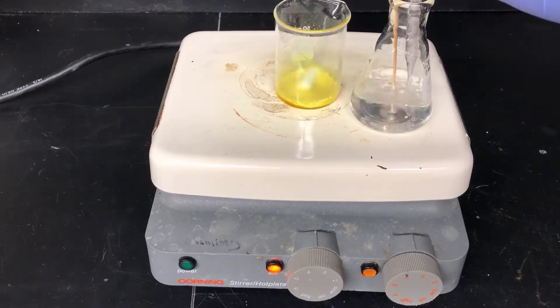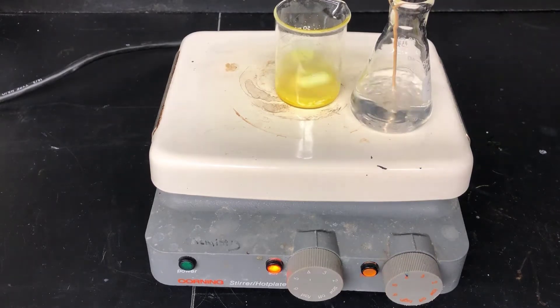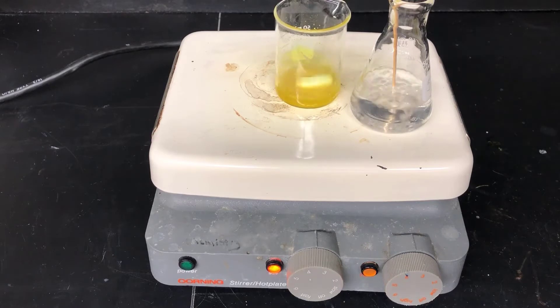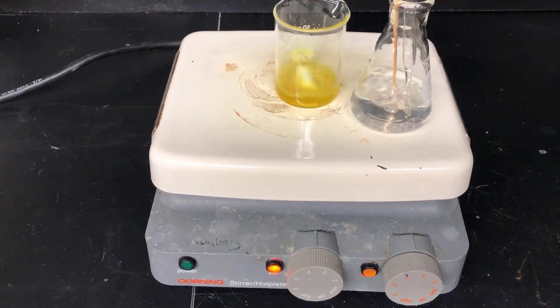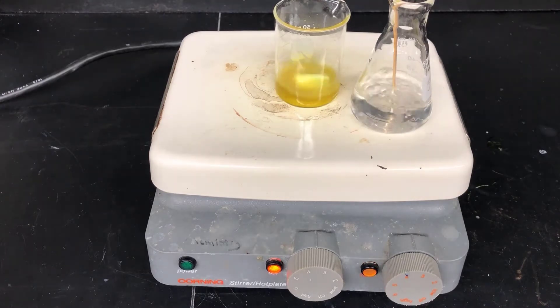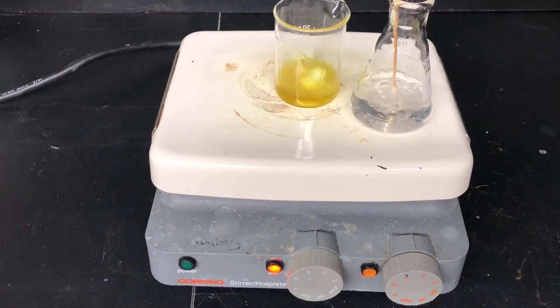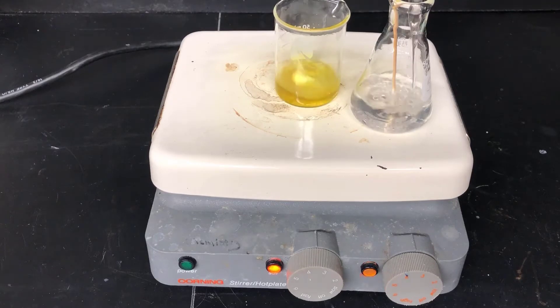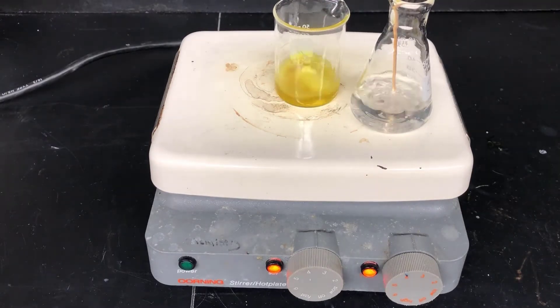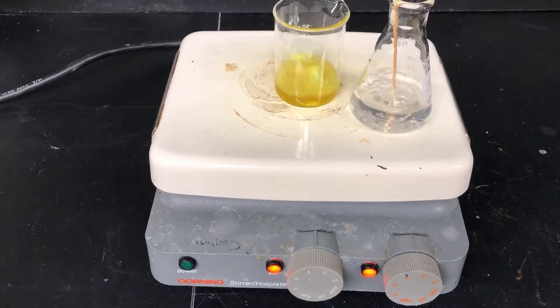I'll need to add more to get it to dissolve, so I'm adding the boiling isopropyl alcohol one pipetful at a time, watching to see if the product dissolves. If it doesn't dissolve, I'll add another squirt and keep doing this until I add enough boiling isopropyl alcohol to just make the solid dissolve. While adding isopropyl alcohol, I'm also losing some due to evaporation. If you add it too slowly, the beaker could dry out and the product could char, so you have to make sure you add it fast enough that the volume in the beaker is actually going up.